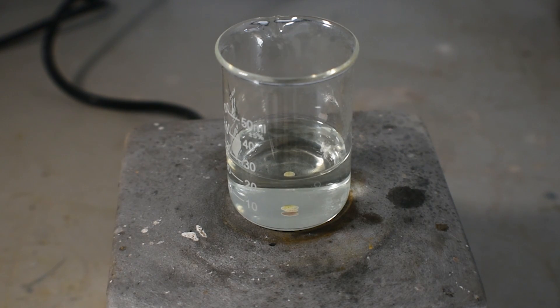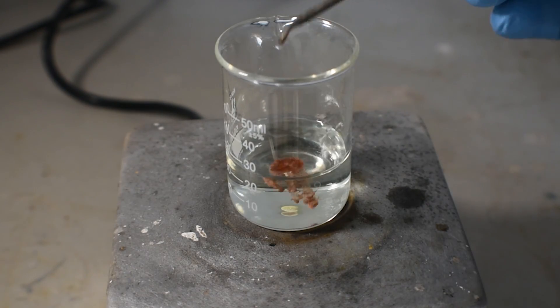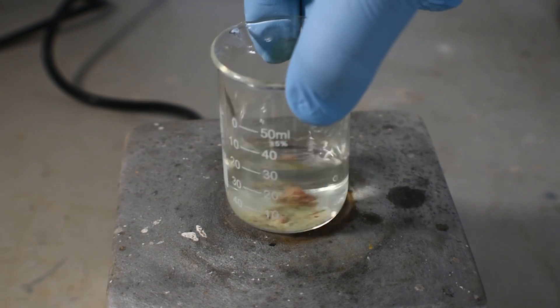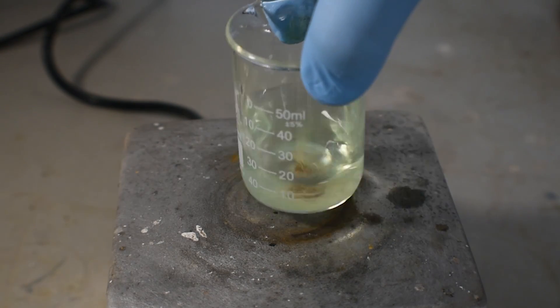This may re-dissolve depending on the concentration of the acid, and in my case it did re-dissolve. The copper-2 in the salt reacts to form its usual green tetrachlorocuprate complex in solution.